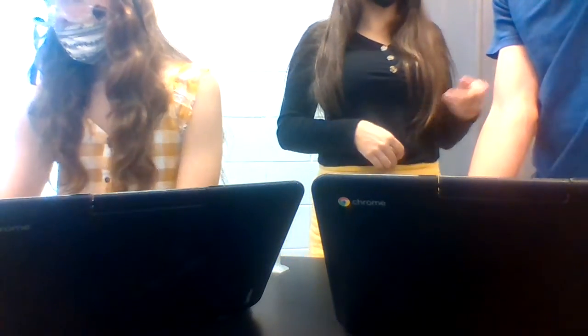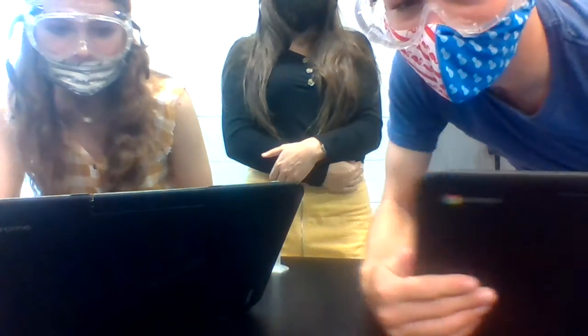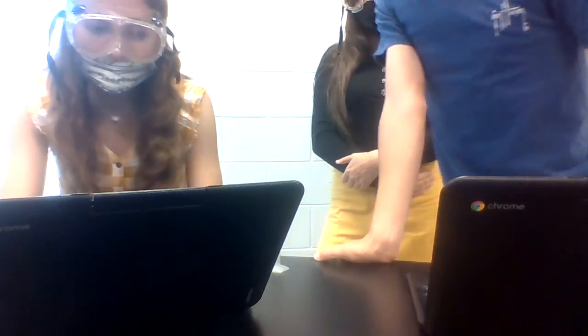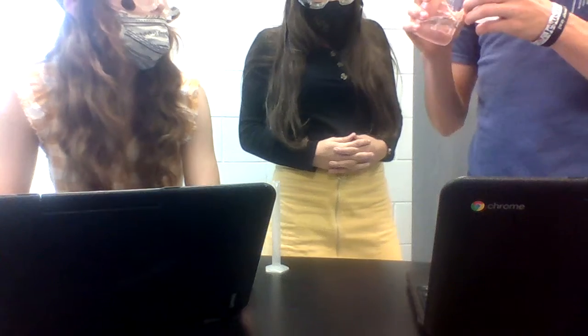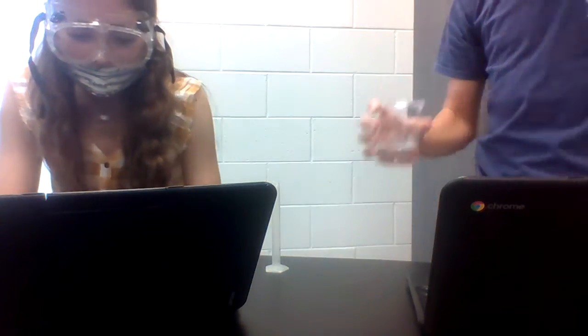We'll just restart. Okay, so what was it when we first poured it? 170 something. Are we gonna keep the number the same, or are we gonna change it? So right here, are we gonna write 2 milliliters? Each one's got to be repeated 2 more times. There's 3. So do we just write 1.7 something? Sure.